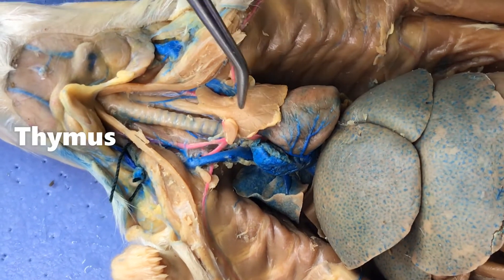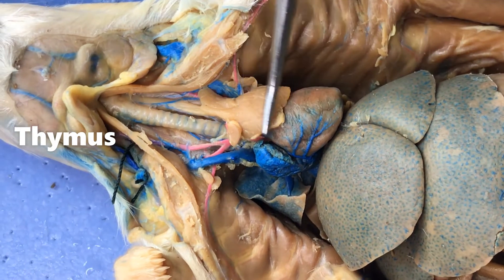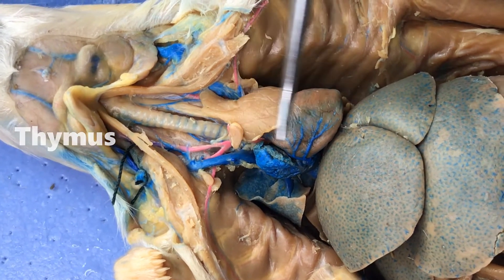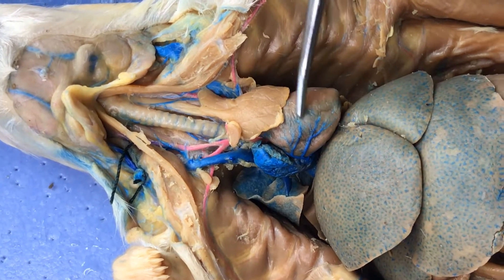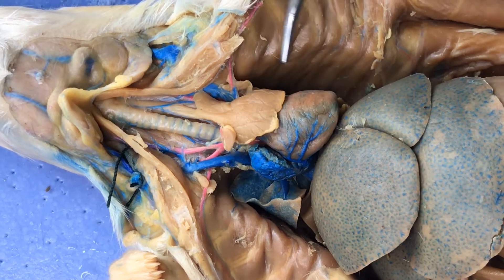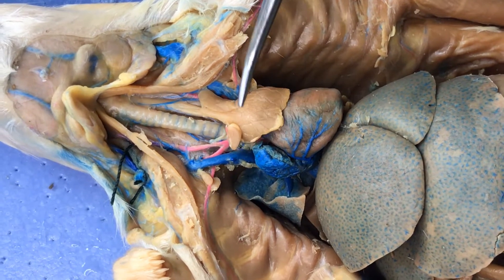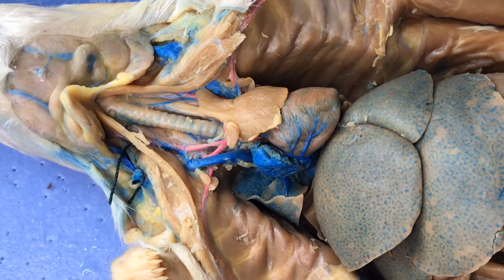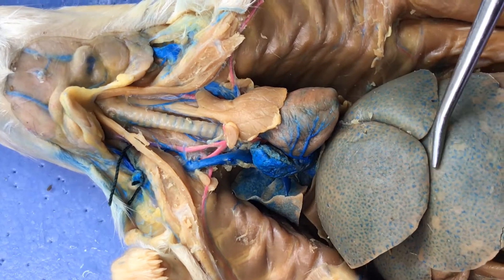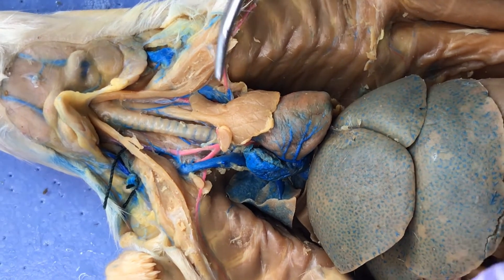This is the thymus — it's a big, lobed gland that lies right on top of the heart. Here's the heart. Anything you see kind of flopped over the heart like this is the thymus. The functions of all those will be covered in a later video and are in your book.